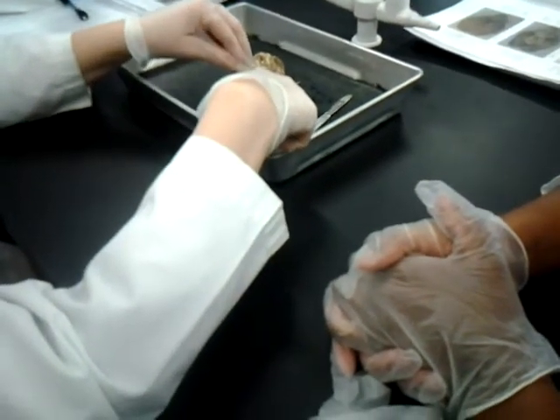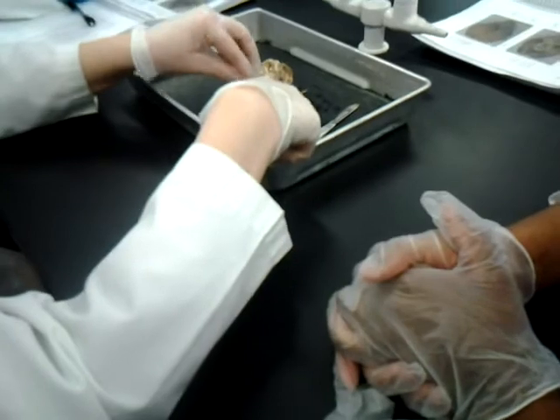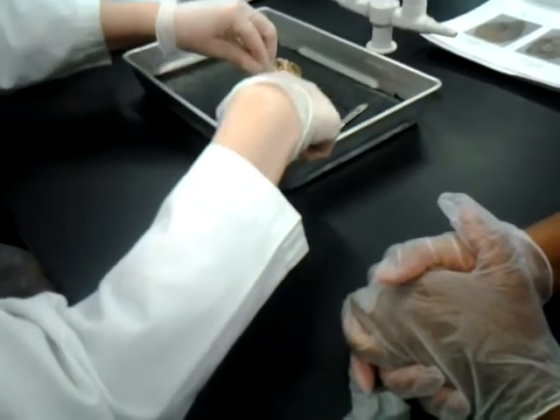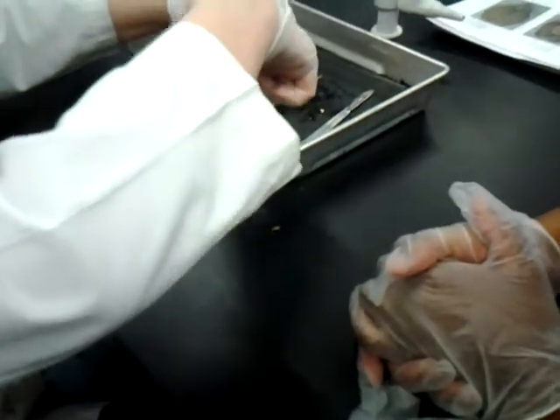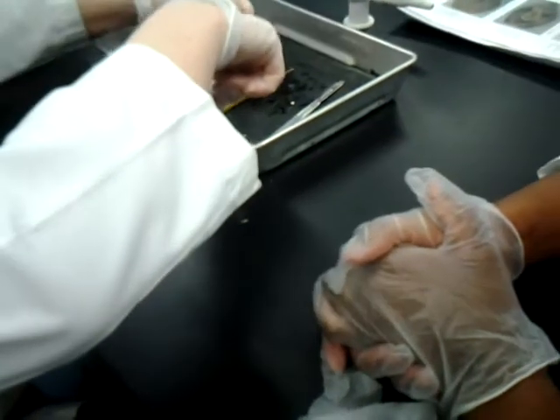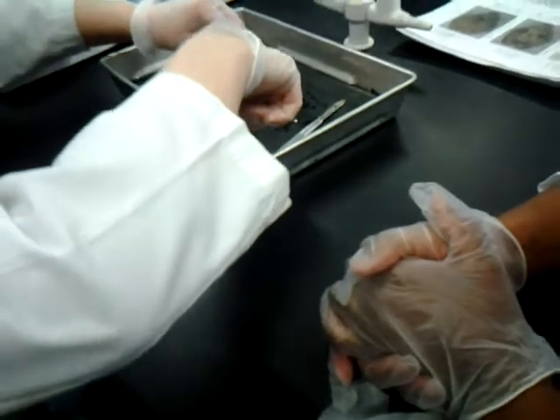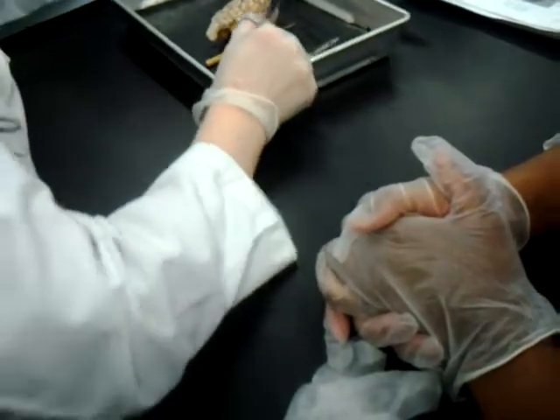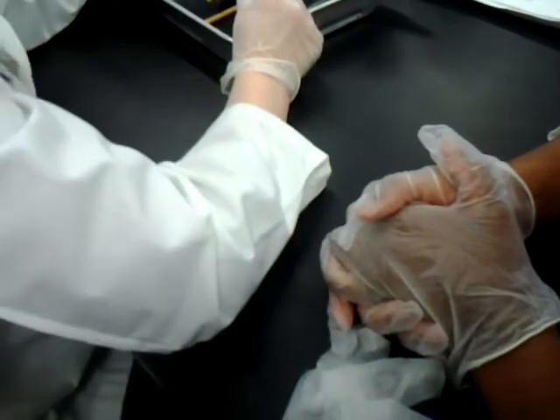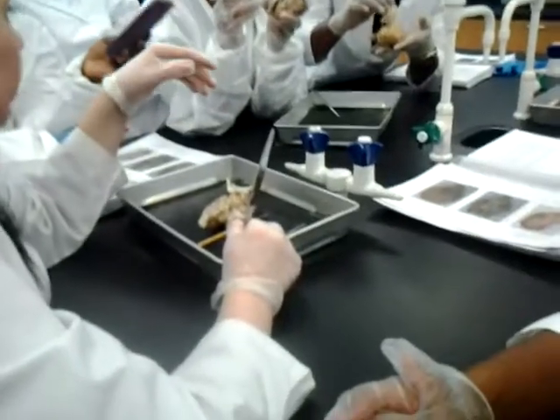The trigeminal is on the side of the pons, and many times it gets ripped off. So what you do is you carefully lift, and when you see the white lines, try to cut them right at the top so they don't rip off completely. So you just kind of cut and then cut them at the top. Mine are only hanging on by two. And those you don't even need, so you could rip that off if you wanted to.